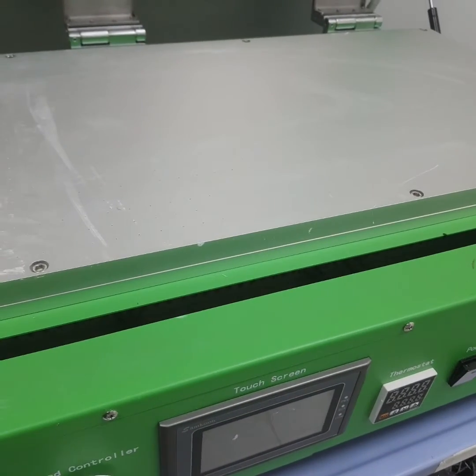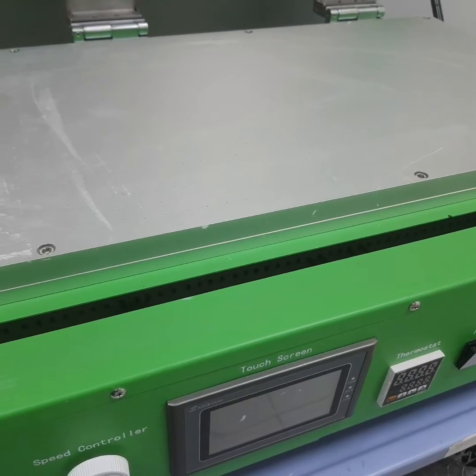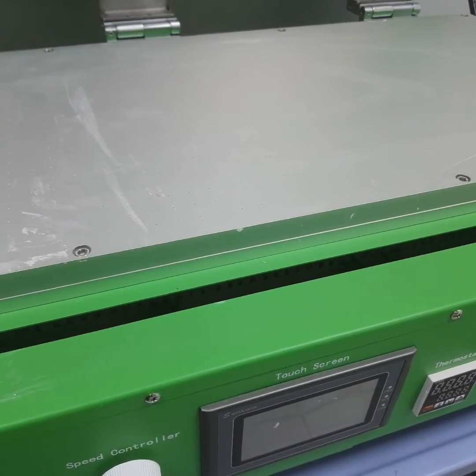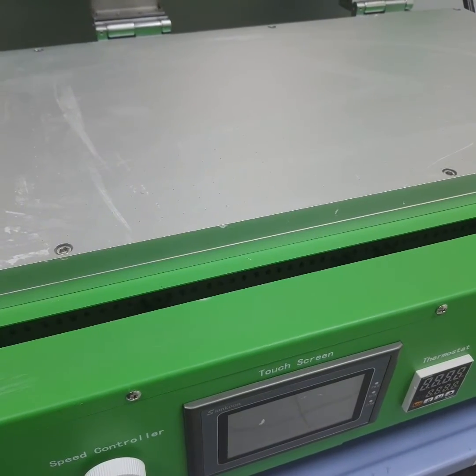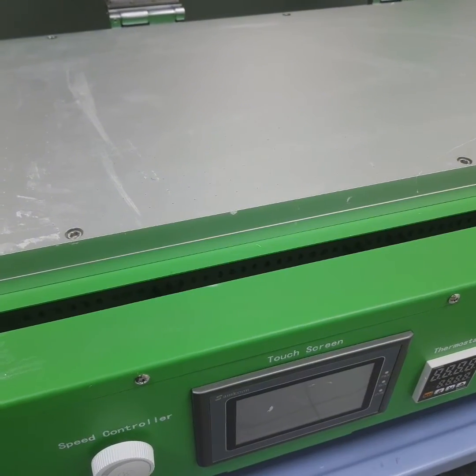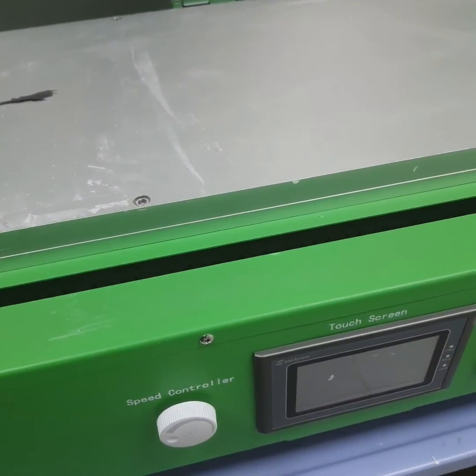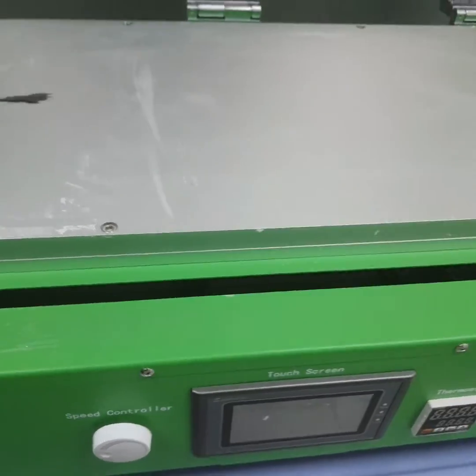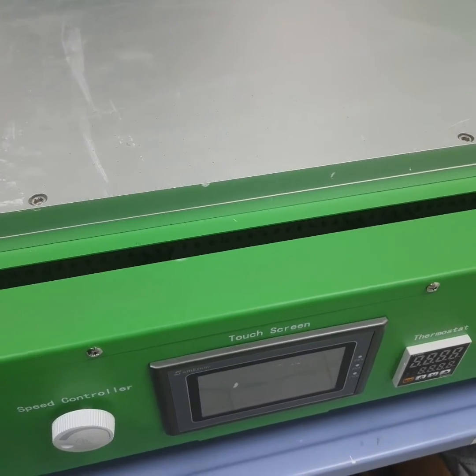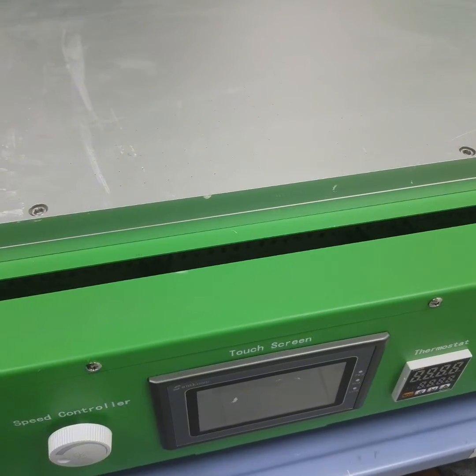So guys, the machine in front of you is a phase inversion machine that is being used to prepare the membrane. Phase inversion or phase separation, as we can call it by two names, is a chemical phenomenon exploited in the fabrication or production of artificial membranes, and it is performed by removing the solvent from a liquid polymer solution, which leaves a porous or pervious or a solid membrane.